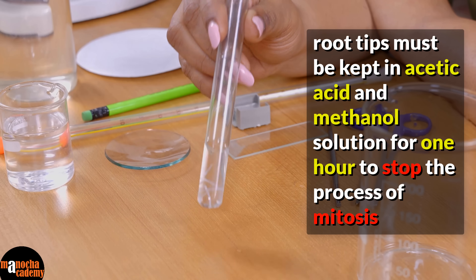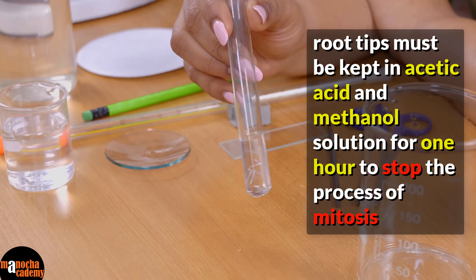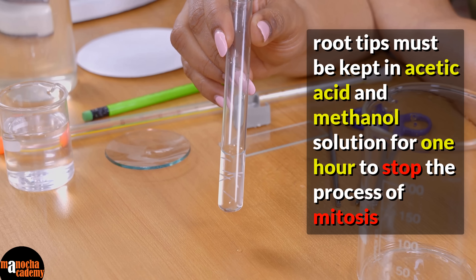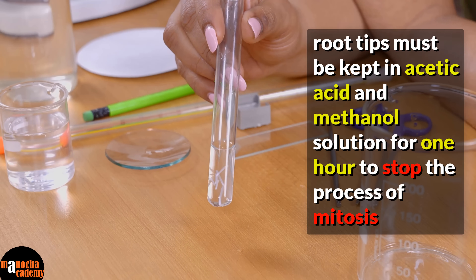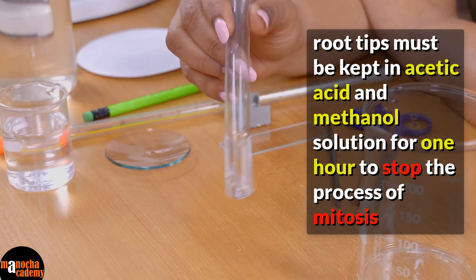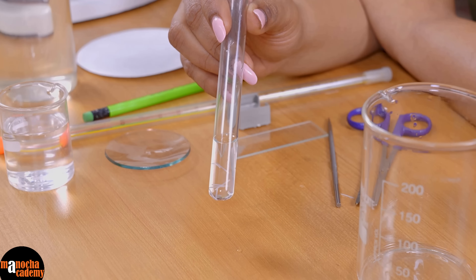So if the cells are in metaphase we want them to stop at metaphase; if they are in anaphase we want them to stop at anaphase, so that we can observe the stages. If they all complete cell division then we will not be able to see any of the intermediate stages.